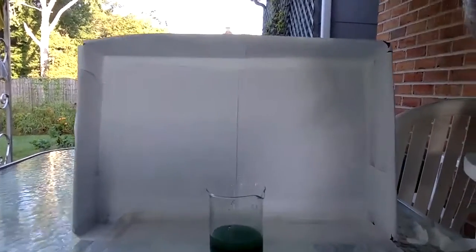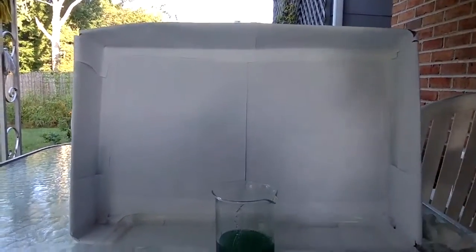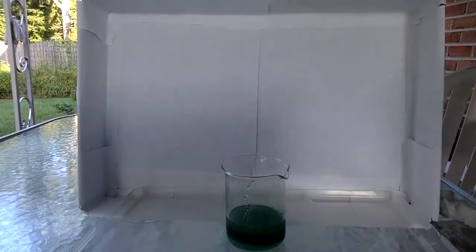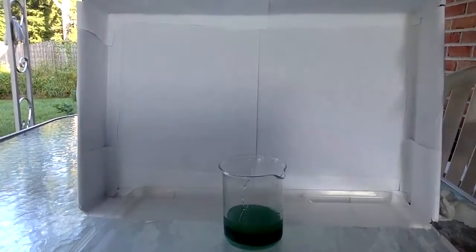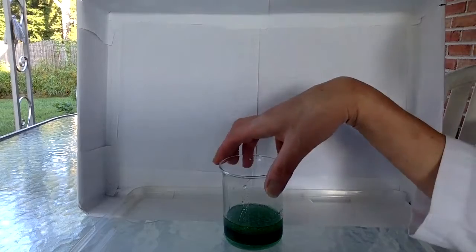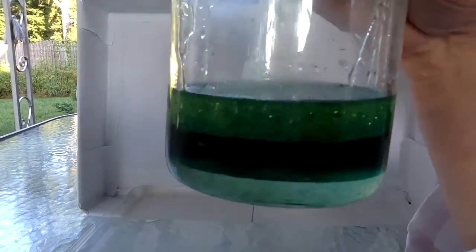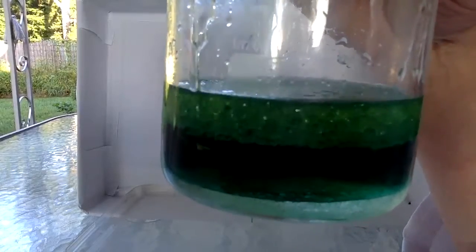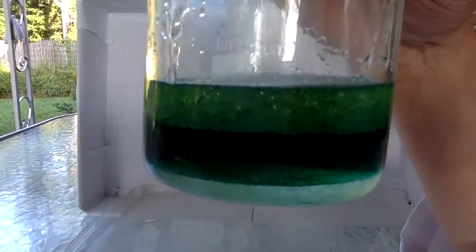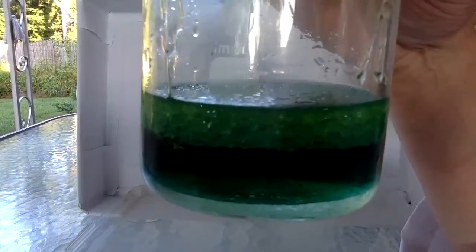What do you notice? That didn't help. All right. Ooh, it's pretty interesting. I'm going to pick it up and bring it closer to the camera. Is that what you predicted? Tell me what your hypothesis was and what you think is where.